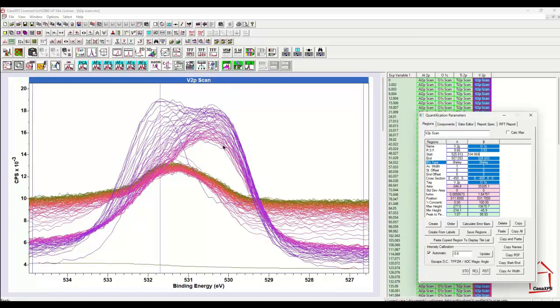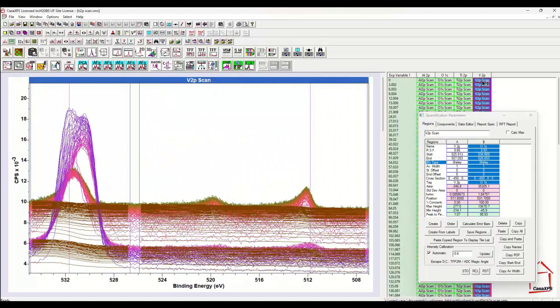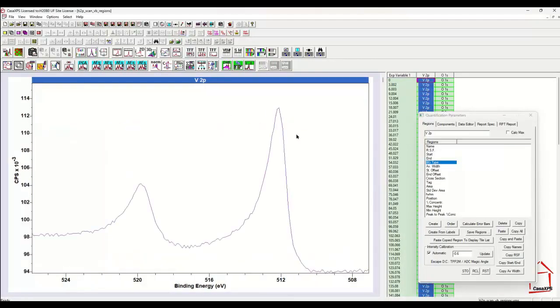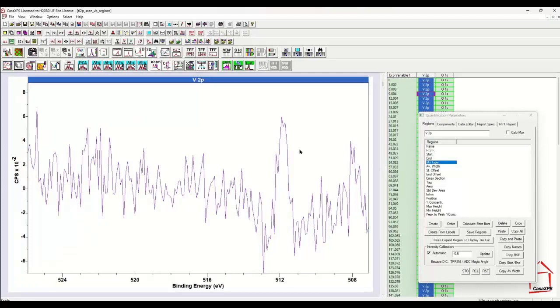So since they are now selected, I can propagate these regions so that the entire set of vanadium 2p spectra now have these same 2 regions defined, and then pressing the toolbar button I can create a VAMAS file that now contains the vanadium 2p on its own. And the advantage of this can be seen if we perform PCA on these data and then look at the number of abstract factors, and it's about 3 that would represent signal.